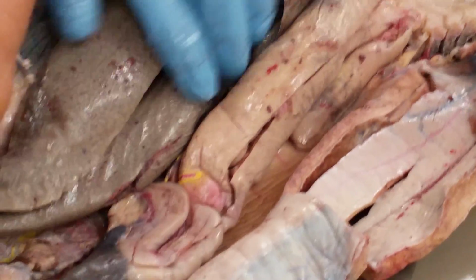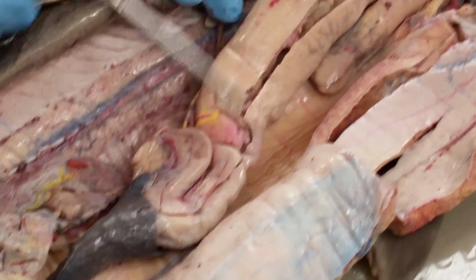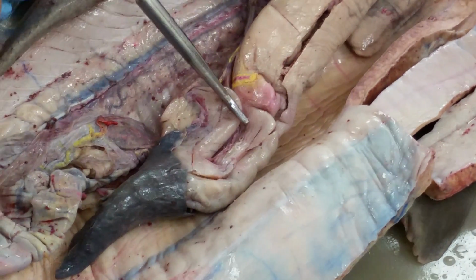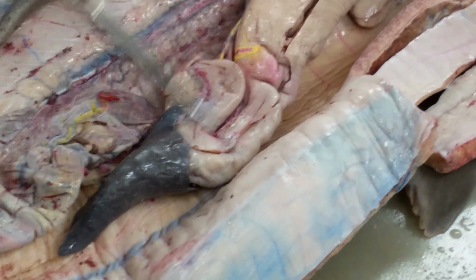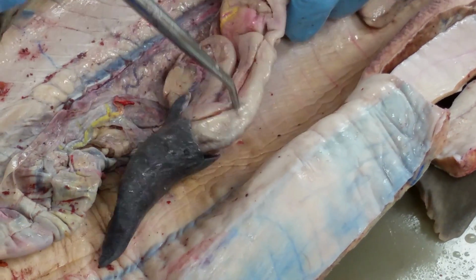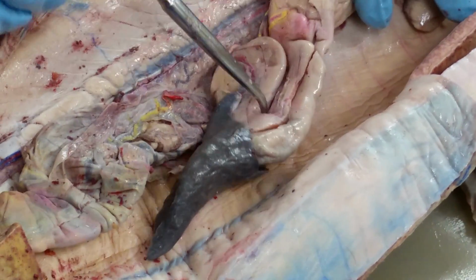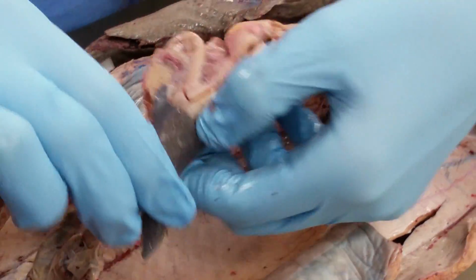Okay, there's different sections of the stomach. This top section is the cardiac portion of the stomach. This section is the body of the stomach. So those are also sections in the cat, right? And then this upward curve of the J is the pyloric region of the stomach. Again, you have the greater curvature of the stomach with the spleen on it, and the lesser curvature, so the inside curvature of the J. Okay, really similar to in cats.